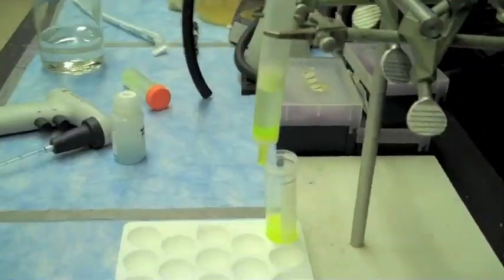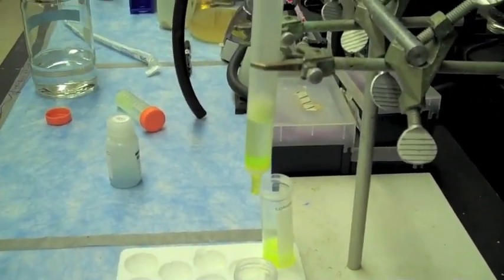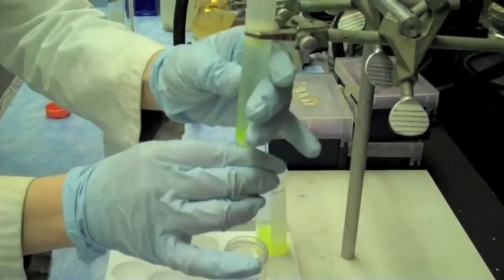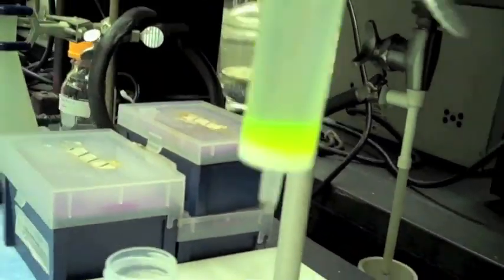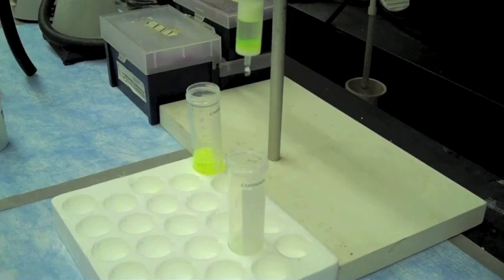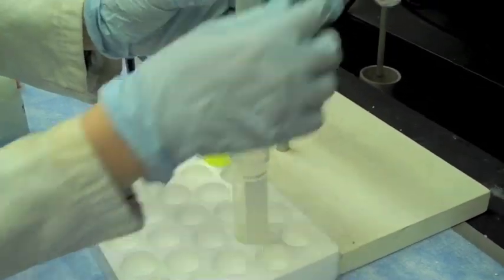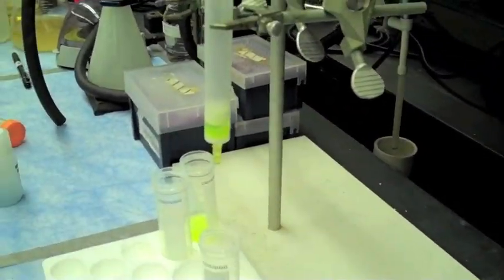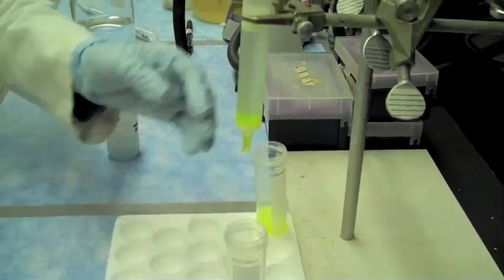Eventually, the solution that elutes from the column will turn clear. At this point, we will continue to wash to remove all the other proteins and material from the cell lysate. After several steps of washing, the beads remain fluorescent as the GFP is still bound.